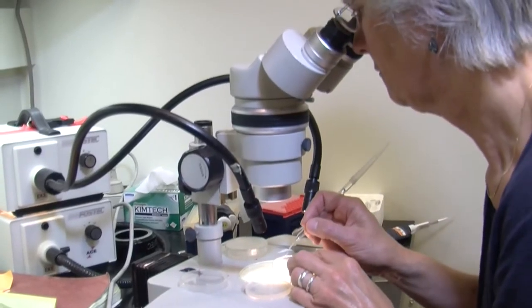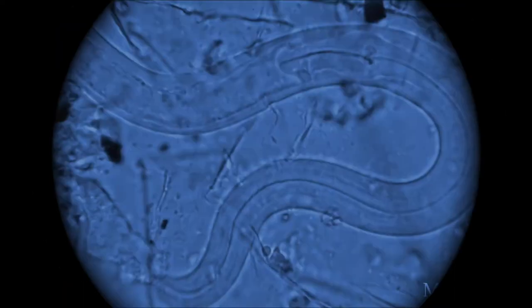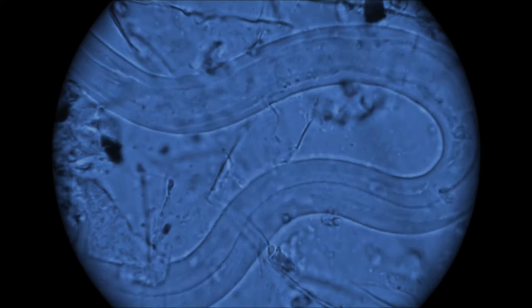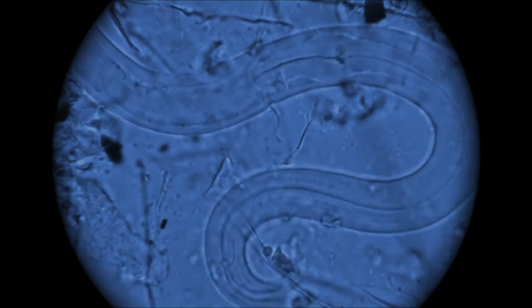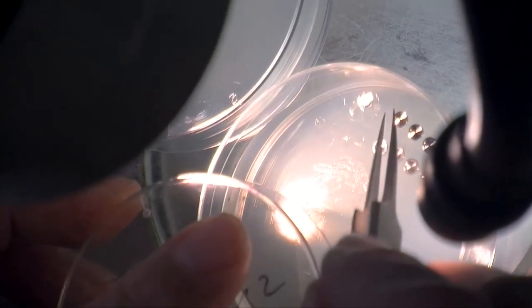And then she'll grab a bundle of live nematodes, and the nematodes get all excited because they eat bacteria, so they think it's lunchtime basically. So they're going to burrow into that little pool of bacteria, and then we put another aluminum cap on top of that cap.